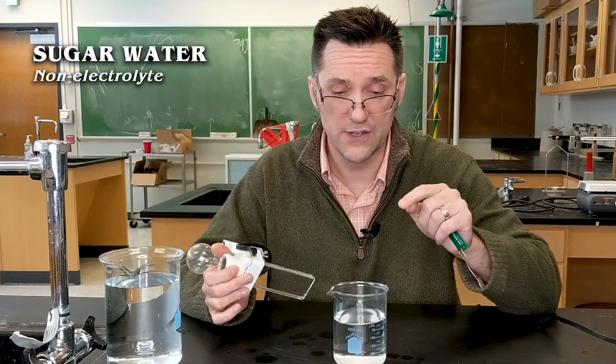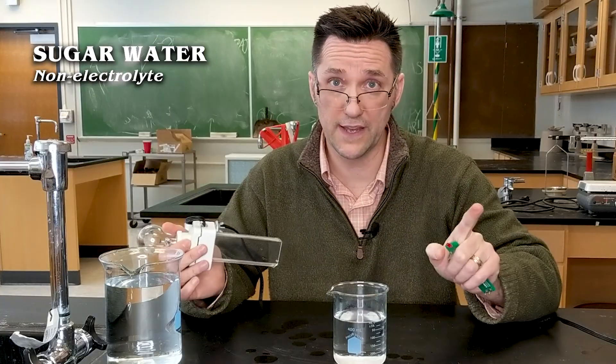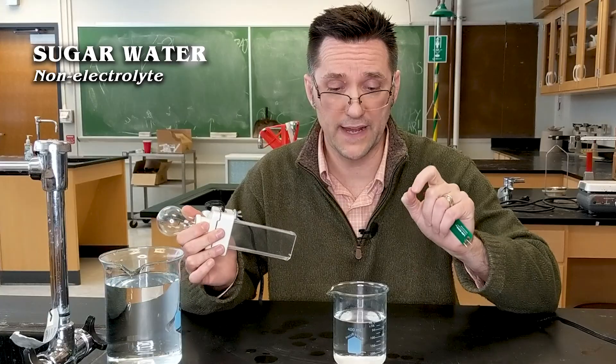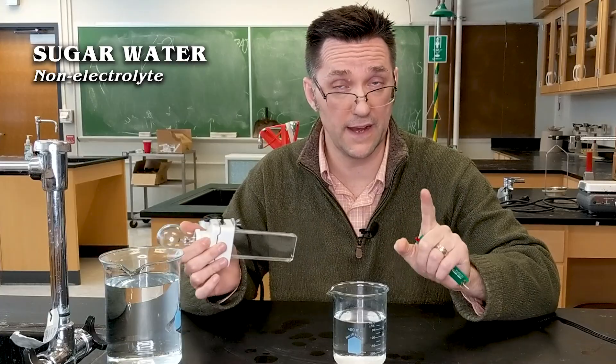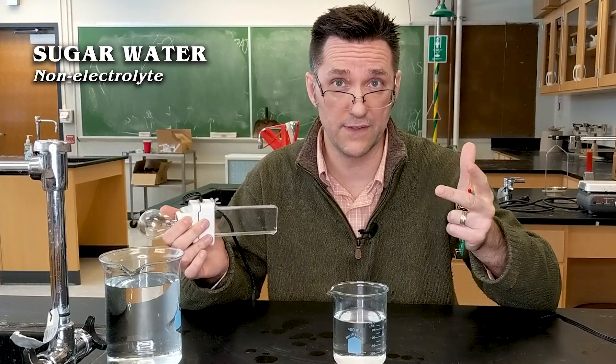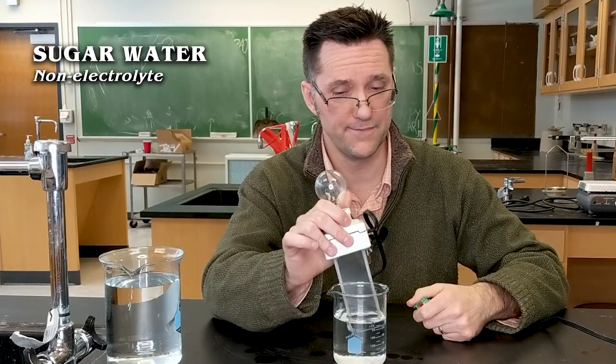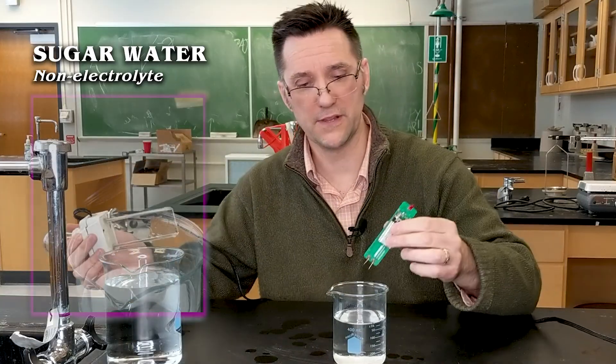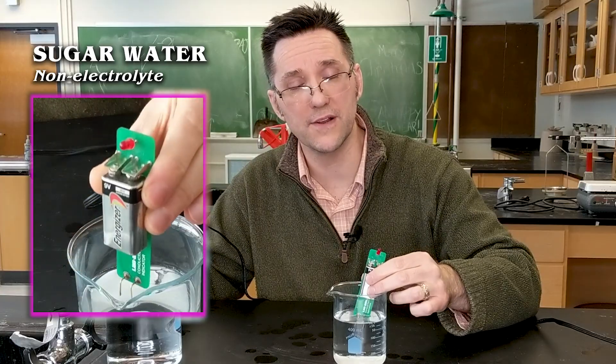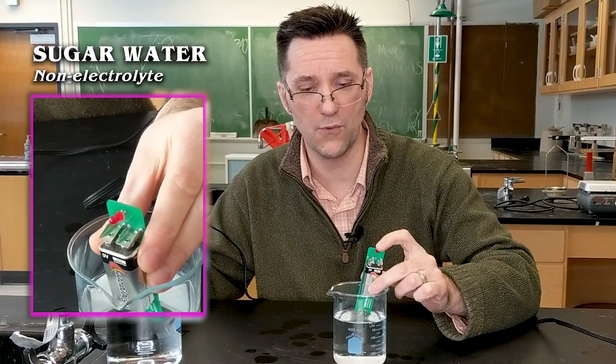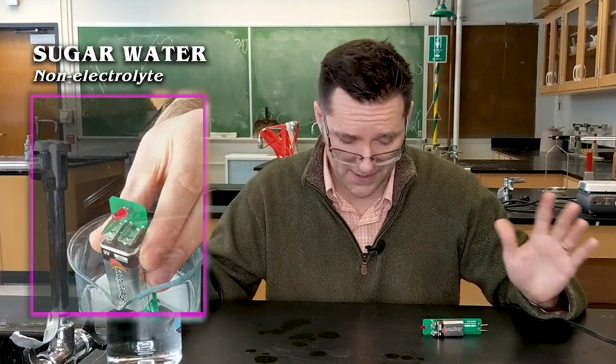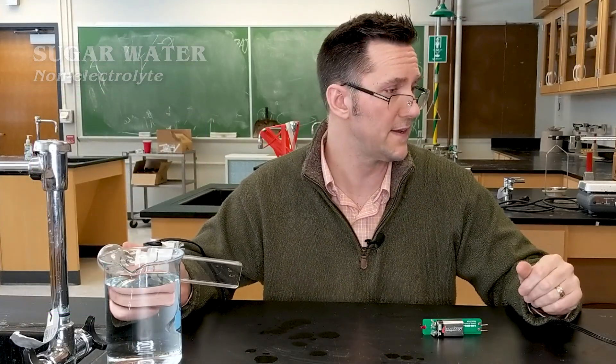Sugar water is next. Sugar water is a molecular or covalent compound. It does not dissociate into ions. Remember that ionic compounds dissociate into the ions, and those ions allow the flow of electricity. There's the big one plugged in, not lighting up. If I put the little guy in, I'm seeing a little bit of flicker, probably just impurities in the water or the sugar. So this has not been at all dramatic. Well, let's start getting to things that actually are electrolytes.